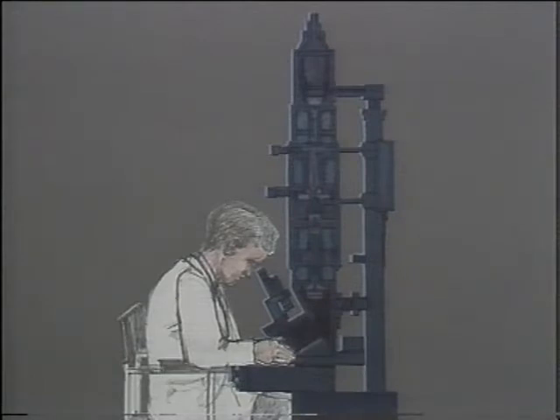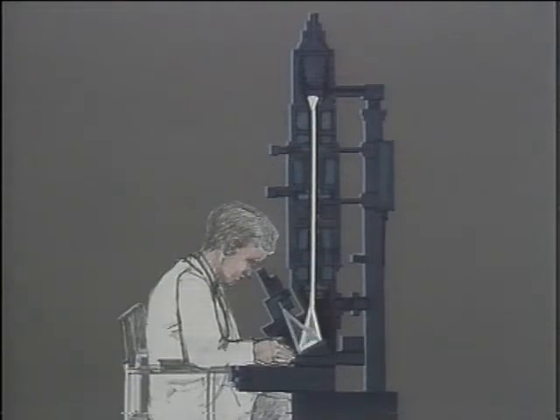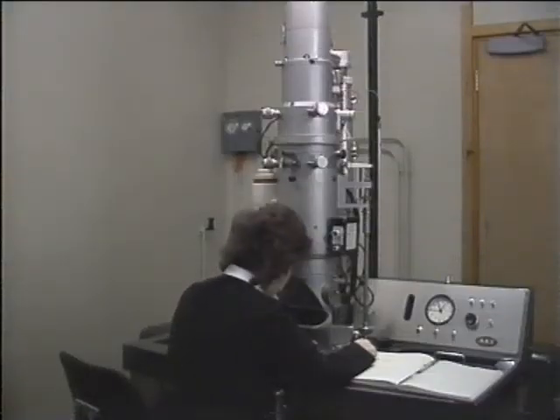The stream of electrons emerging from the anode is focused into a beam by a powerful electromagnet called a condenser lens. The electron beam then passes through the specimen and is finally focused and enlarged by a system of electromagnets, the objective, the intermediate and the projector lens, to give an image on a fluorescent screen, like the image on a cathode ray tube of a television screen.